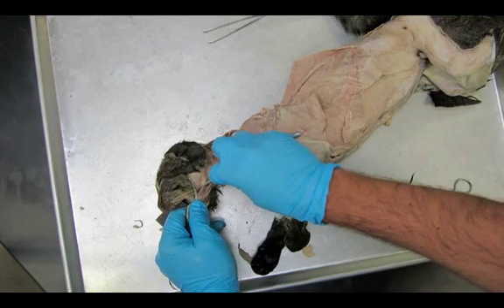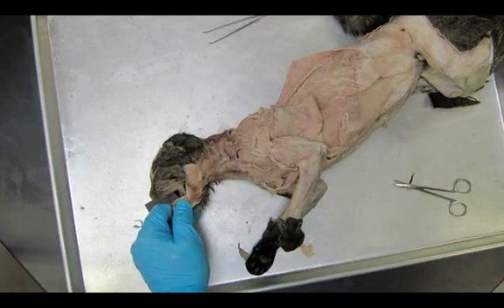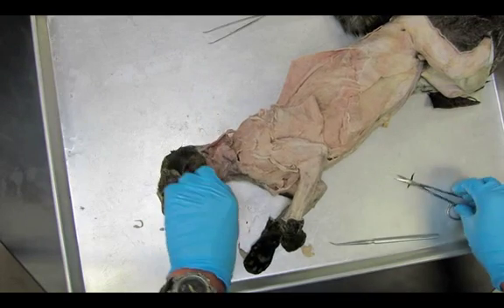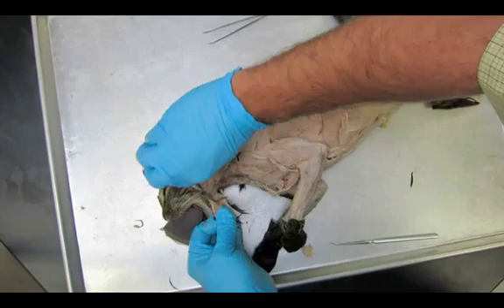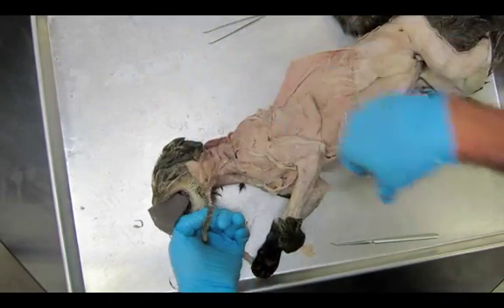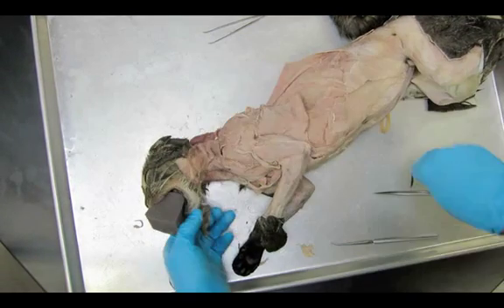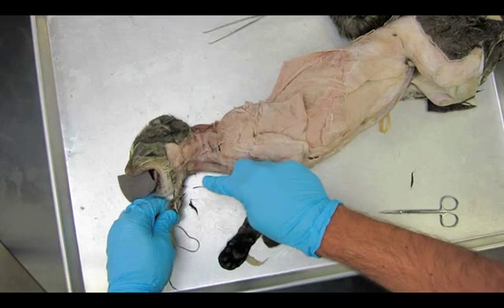You're going to end up getting this nice piece of skin off from under the jaw. Almost all this stuff can just come right off. If when you took off the cat's skin there was a lot of stuff between the skin and the muscles, you probably don't need to worry. But if your cat had a very thin layer of connective tissue and you were worried about damaging muscles, you might need to be a bit more careful when you remove this.